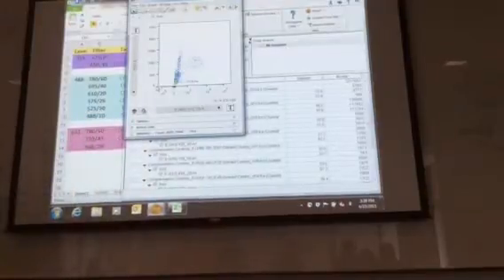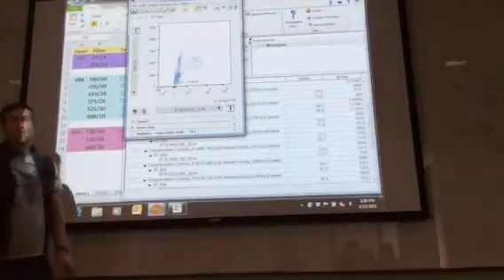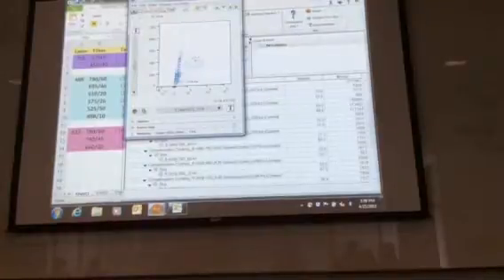So you're looking for the rarer population. It's not always the rarer population because it depends upon what your stain is. In the case of CD45, most of the cells are going to be positive for CD45, so you have to know what it is that you're staining for. That's why using an unstained control will give you an approximation, but with this, you're not too worried about what's positive or negative here.